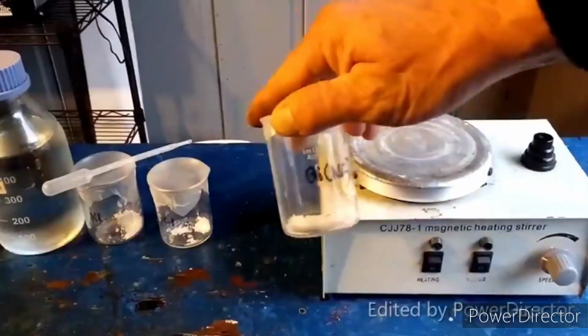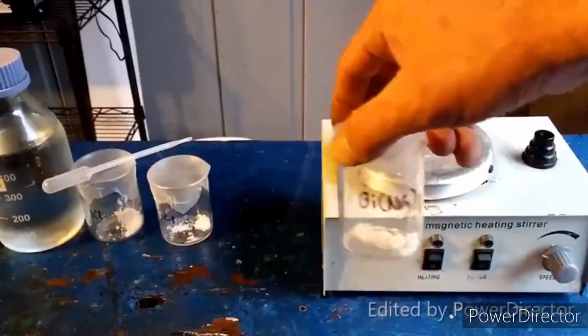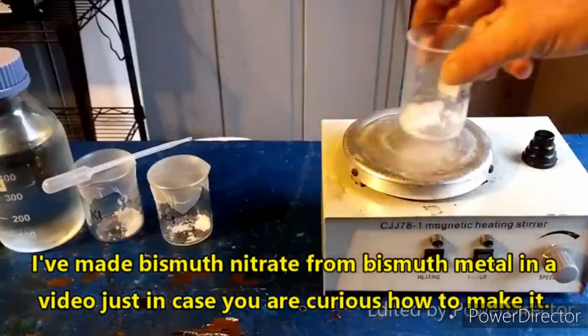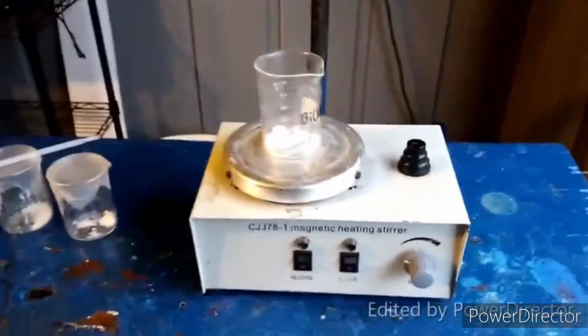We're going to take some bismuth nitrate that I've got here. This is 2.4 grams of it because that's just what I happen to weigh out. Put that up there. There we go. Alright, let's move this over here.